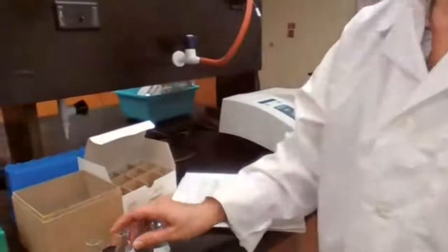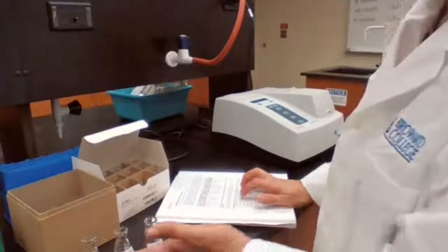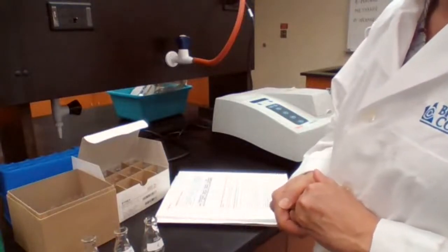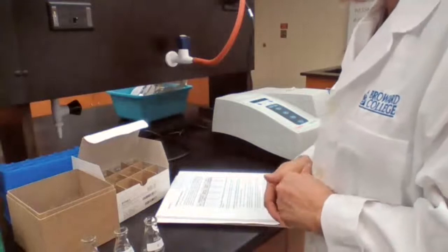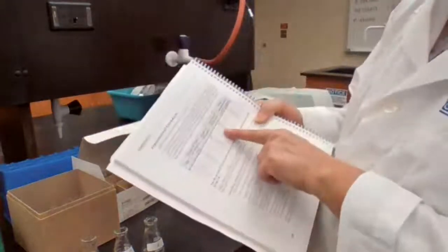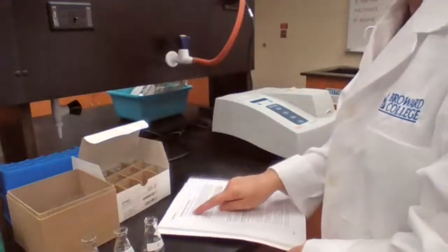I already have five Erlenmeyer flasks here. They must be dry because we don't want to change the volume. Volume has to be accurately measured. One of the best devices in the lab to measure volume accurately is a burette or pipette, but the burette is more practical because we can use different increments of volume. We are going to follow the table provided in the procedure to fill up the flasks.